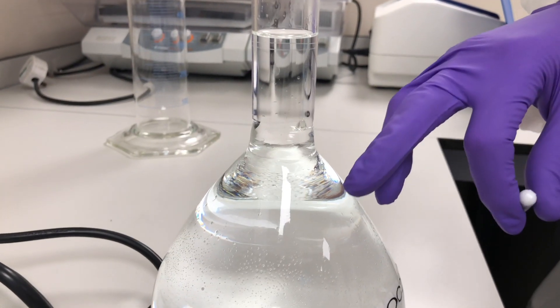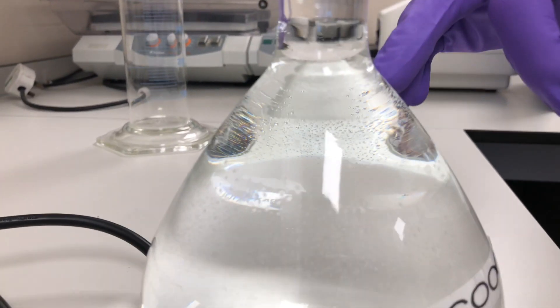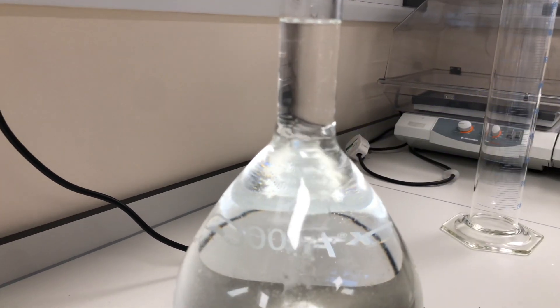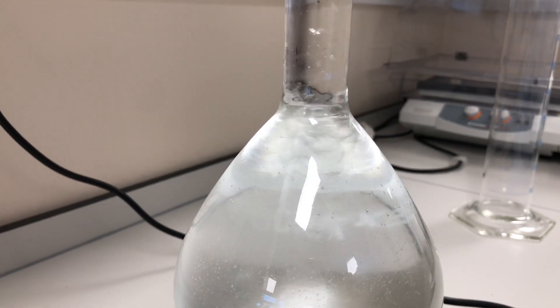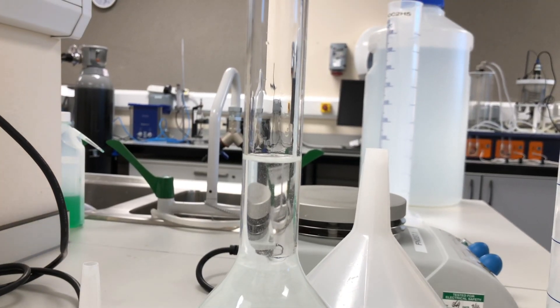As you can see here, there's two layers there. Ethyl acetate is slightly immiscible with the distilled water. But if we heat it up with a stirrer, it should dissolve. See there, the two immiscible liquids. As it starts to heat, it will start to dissolve. There we go. So we made it up to the mark.